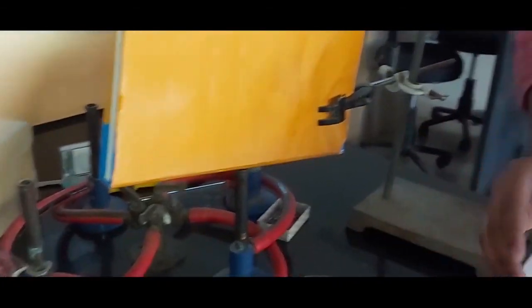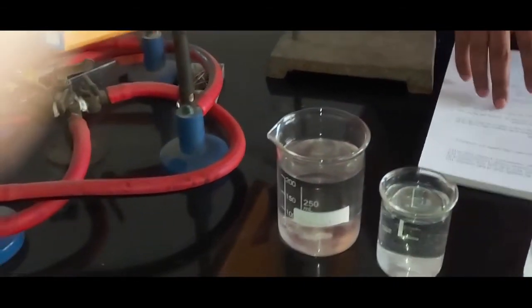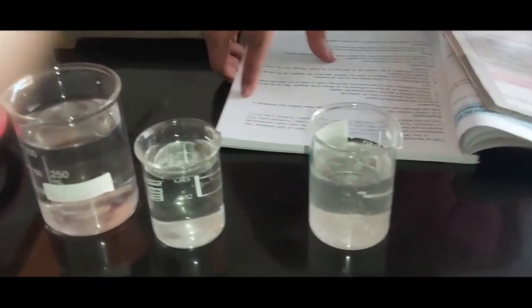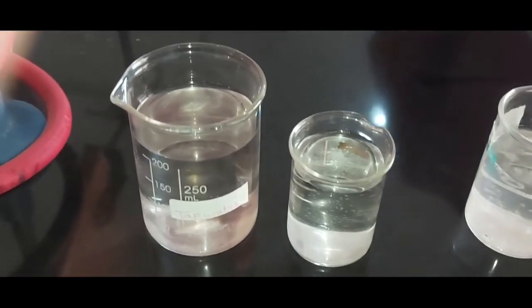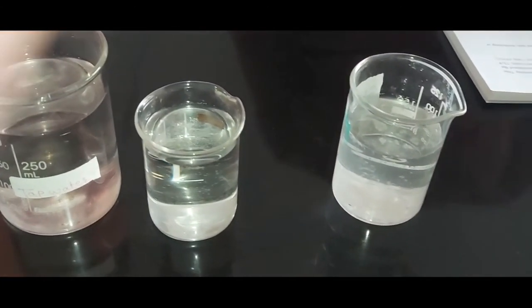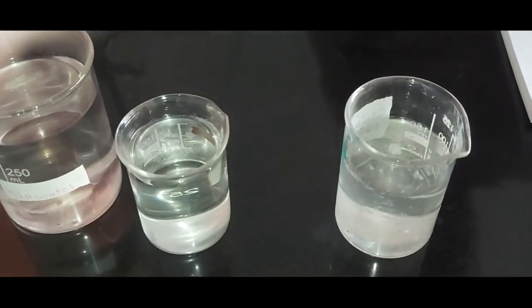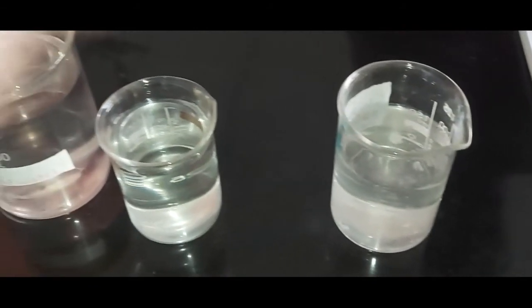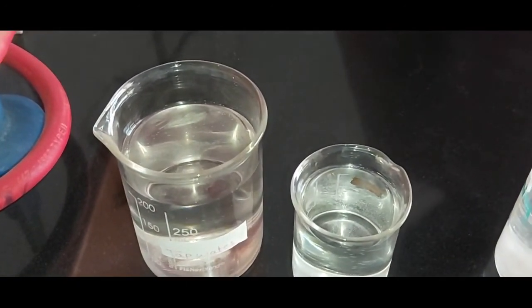These are the three different water samples which we tested for clarity. After observations, the conclusion will be: a turbid water sample is less clear and more polluted, hence it is not suitable for consumption without treatment. Thus, the clarity of a water sample indicates the degree of pollution in it.